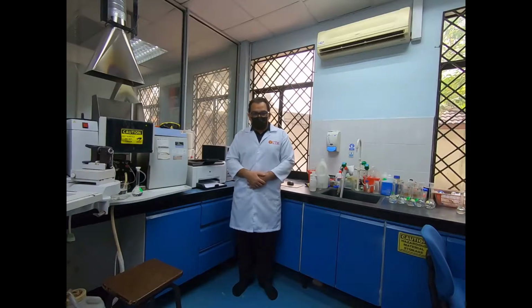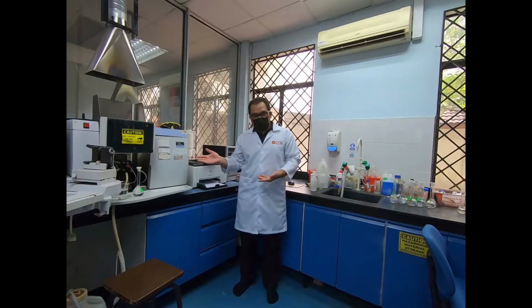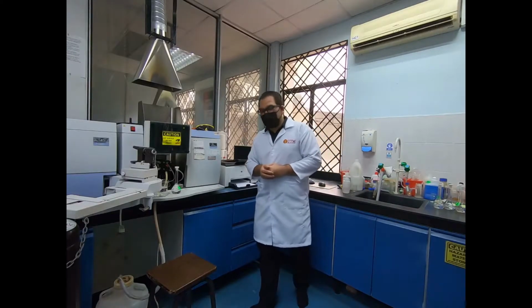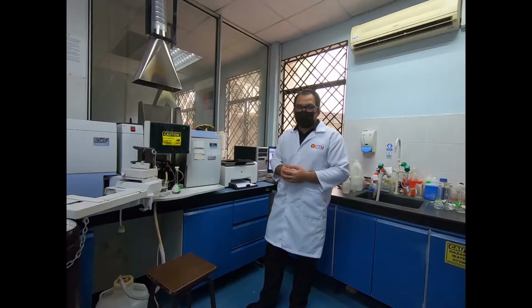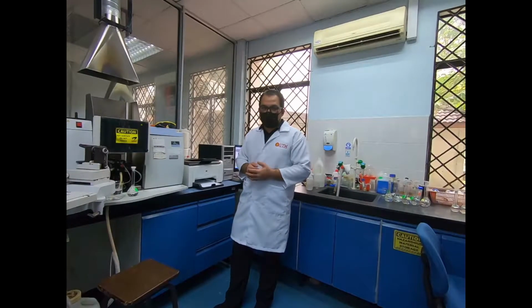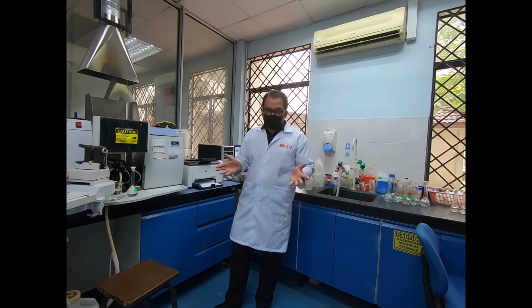Now, I am going to explain to you about our experiment number 3, which is determination of zinc by linear calibration and standard addition methods using atomic absorption spectroscopy. The machine beside me. Atomic absorption spectroscopy is a technique for determining the concentration of metal element or mineral in a sample. The technique can be used to analyze the concentration of over 70 different metals in a solution. It uses absorption or emission spectrometry to assess the concentration of analytes in samples.